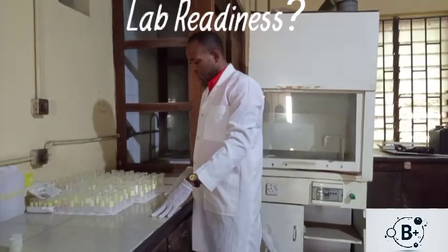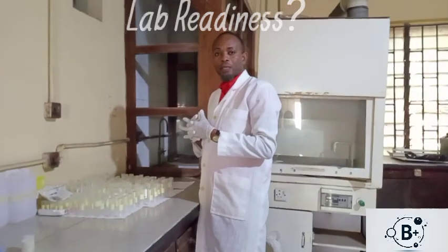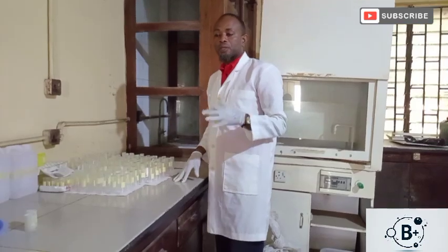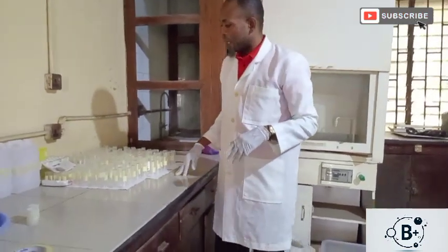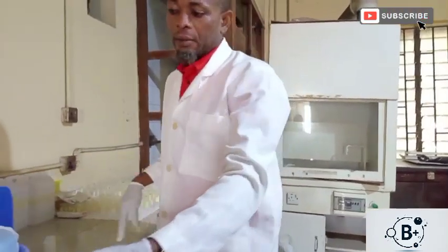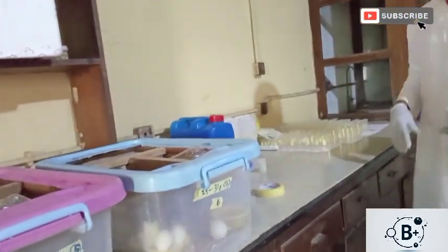Today I want to show us how, at the end of an experiment, say you are having an in vivo experiment that has to do with treatment of animal models. For example, we use mice as animal models, then we can use some primates as animal models.